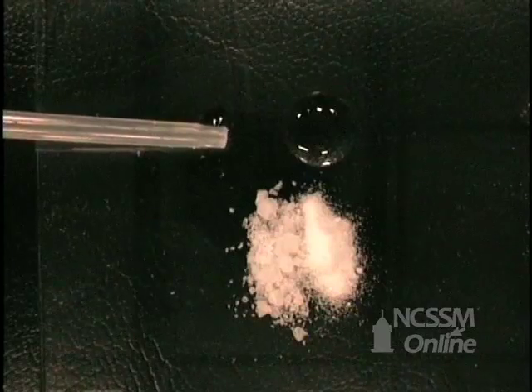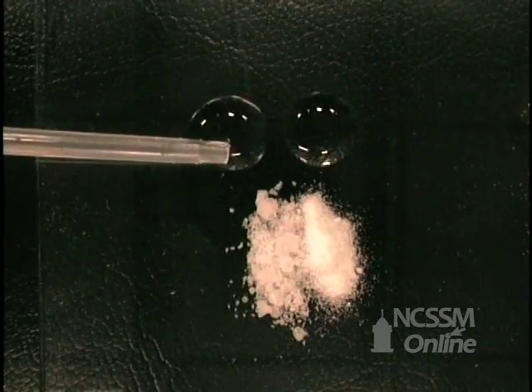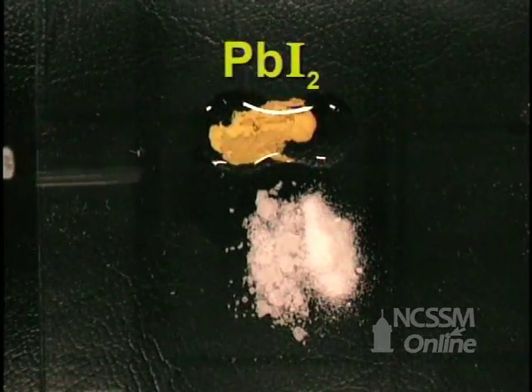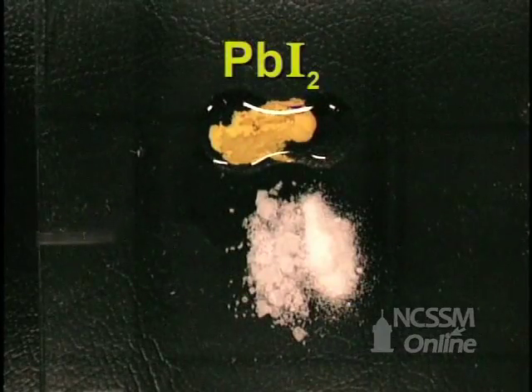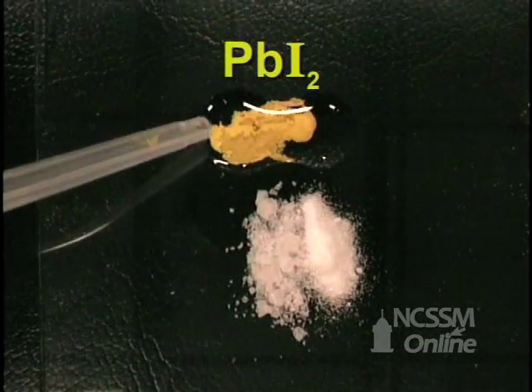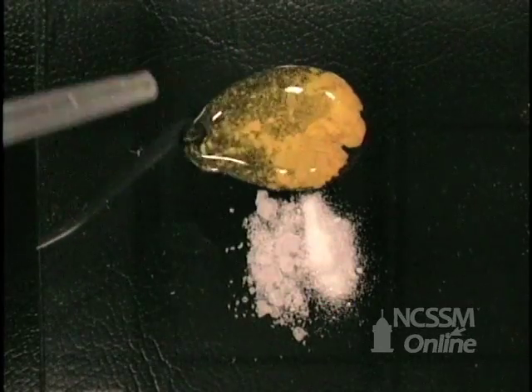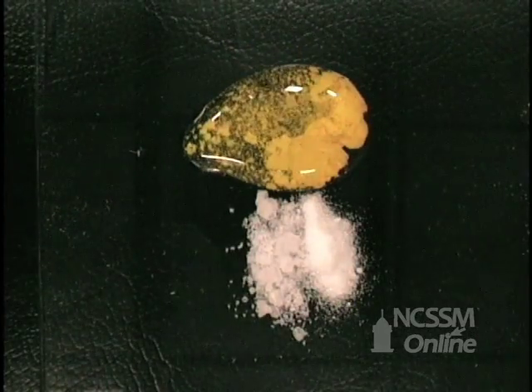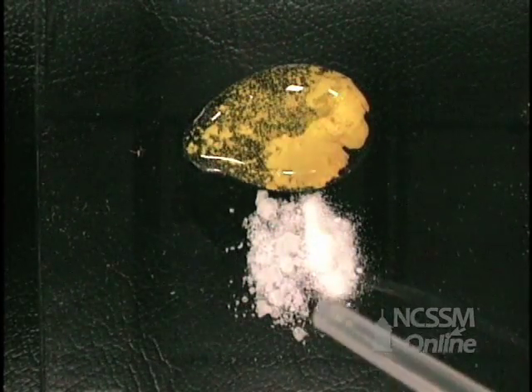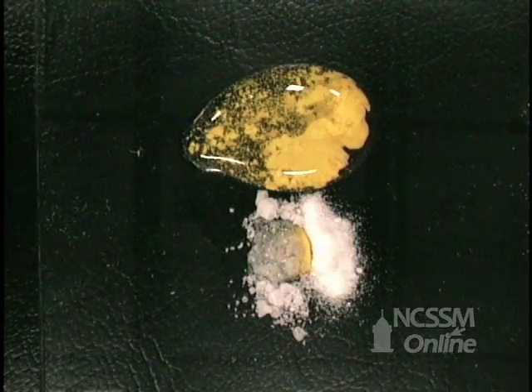But if we take a solution of the same compounds — lead nitrate and potassium iodide — and let the two solutions run together, you notice that as soon as the water touches, the reaction occurs. So having the substance as a solution, the reaction rate is much, much faster.